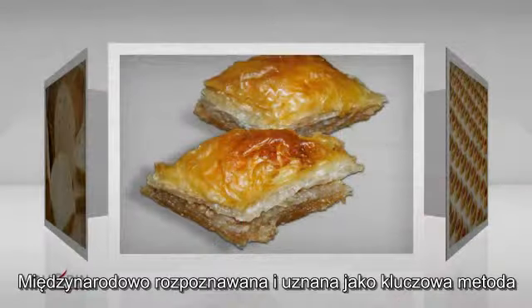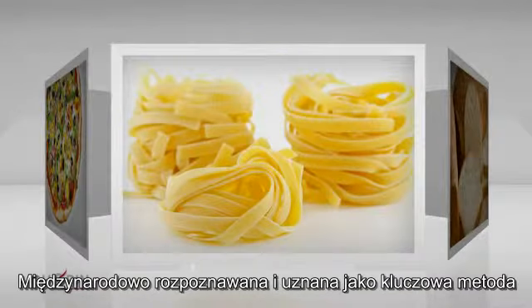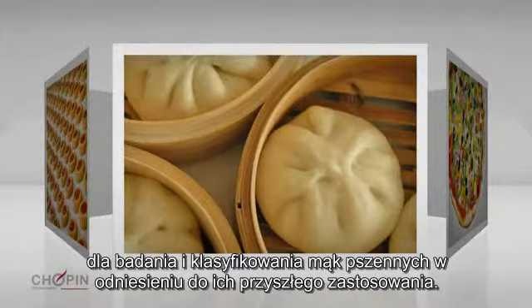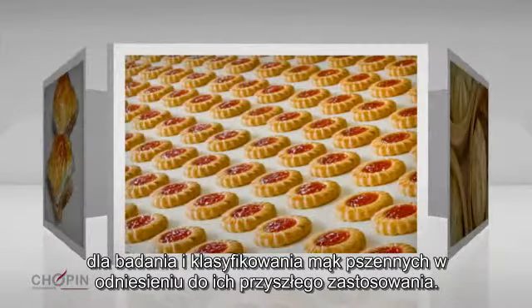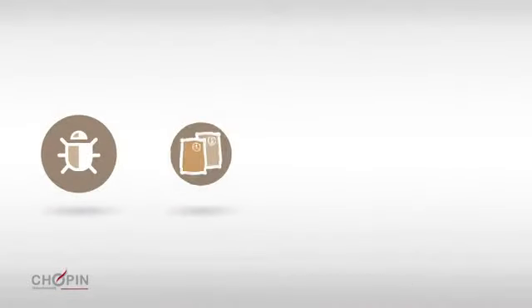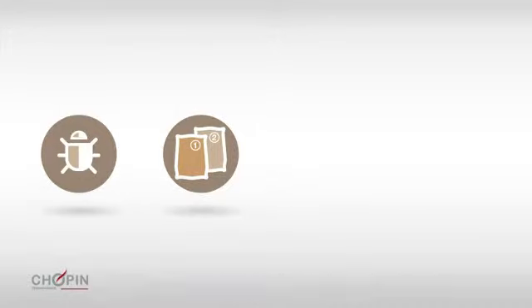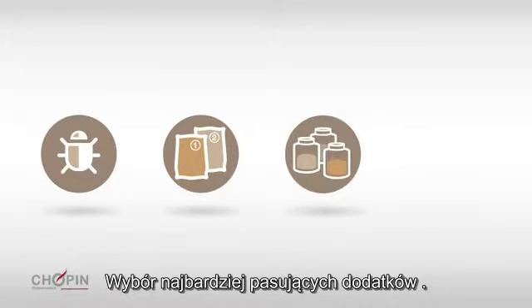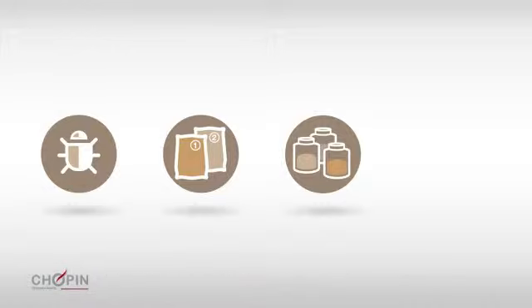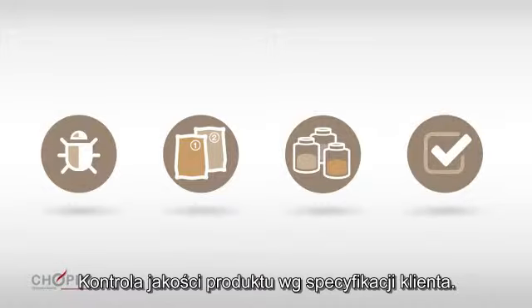It is internationally recognized as the essential and standard tool for testing and classifying wheats in accordance with their future use, detecting insect damage in wheat, defining and optimizing wheat and flour blends, selecting the most suitable additives to improve final product quality, and verifying product conformity to customers' specifications.